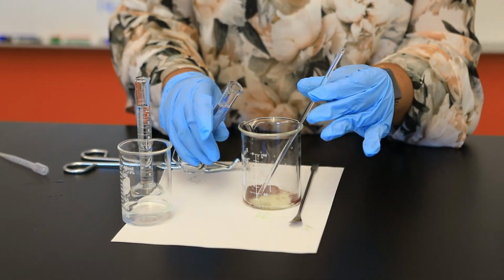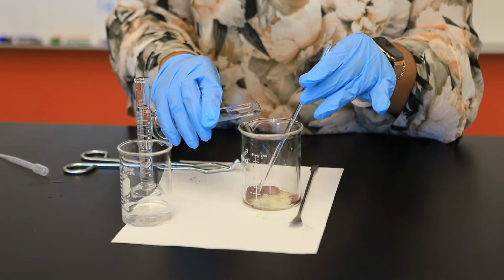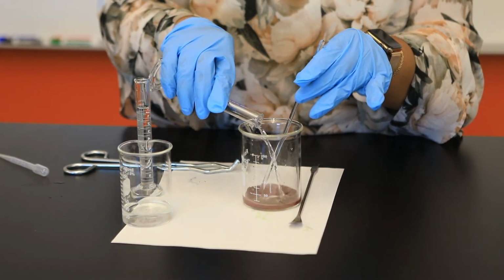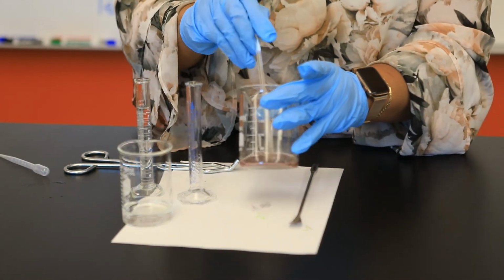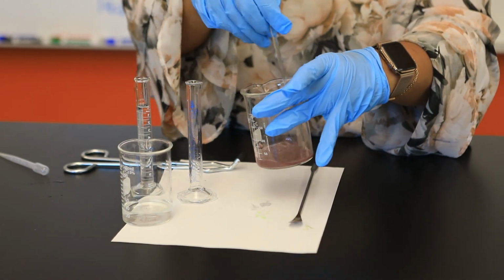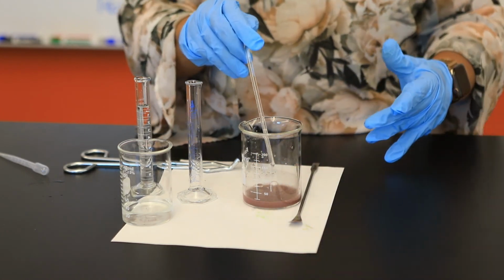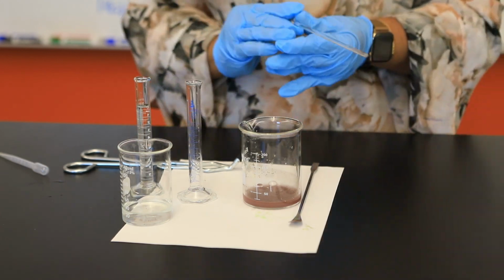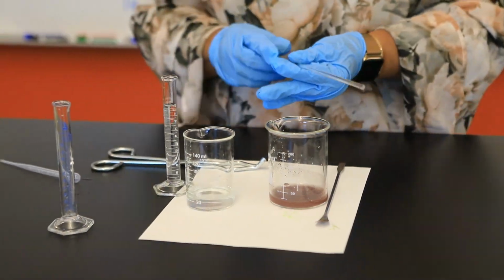Another technique that we talked about was washing. So we want to make sure that we remove any residual HCl or zinc chloride from our copper. So I'm going to wash this twice, with 10 ml of distilled water each time. So stir to remove any HCl or molecules that are possibly adhering to my copper metal. I'm going to let this settle before decanting to avoid losing too much of our copper solid.